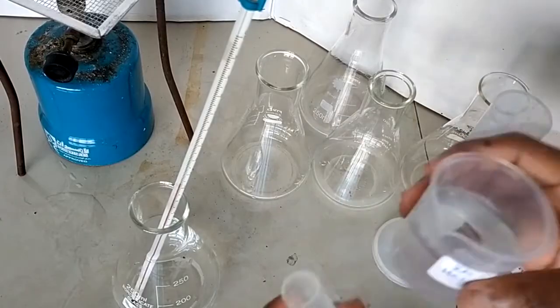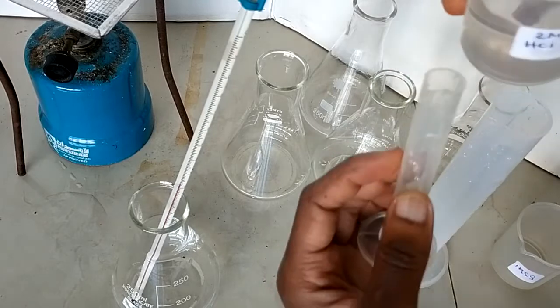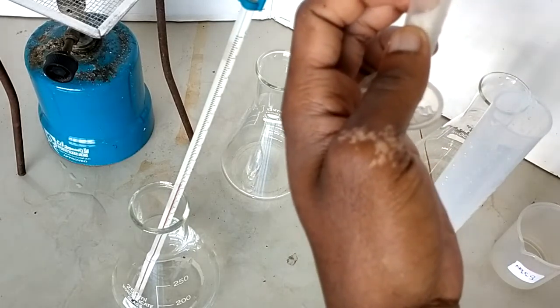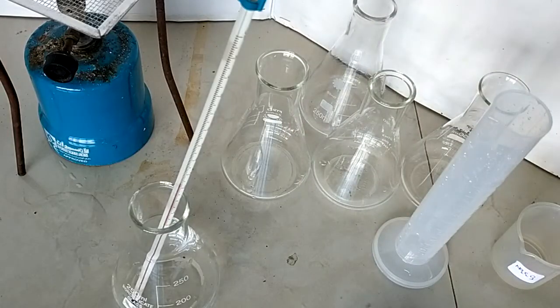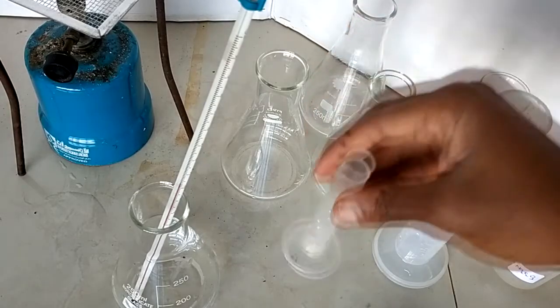So the next thing I'm going to do is to measure two centimeters cubed of two molar hydrochloric acid. I just need two, so be very careful to measure two centimeters cubed. Well, let me do it outside the camera then I'm going to get it back. Okay, great. There you go, I have two cubic centimeters.